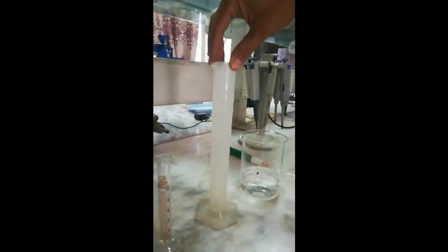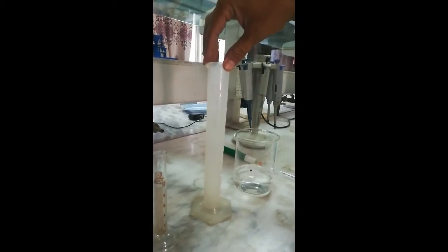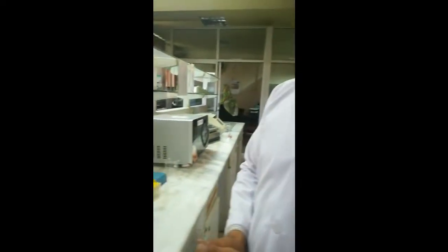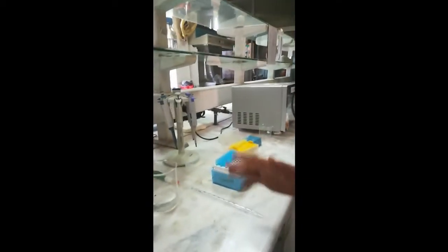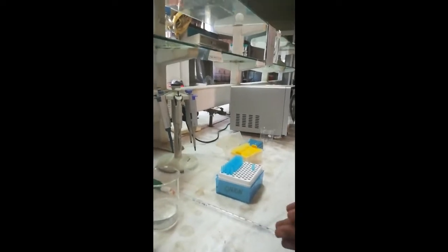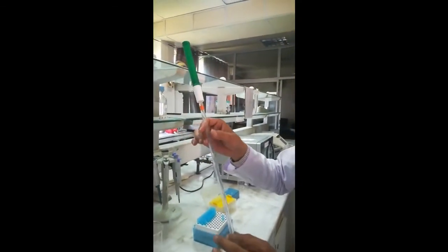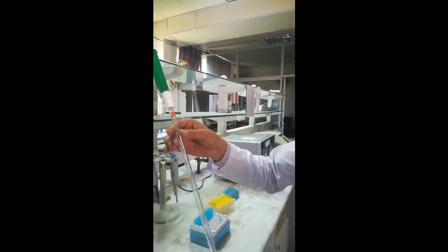We can use these measuring cylinders for measurement of volume of different liquids. If we are dealing with smaller volumes or need to measure an accurate small amount, we use another equipment called a pipette. There are two different kinds of pipettes — here in my hand I have a glass pipette of 10 ml capacity.